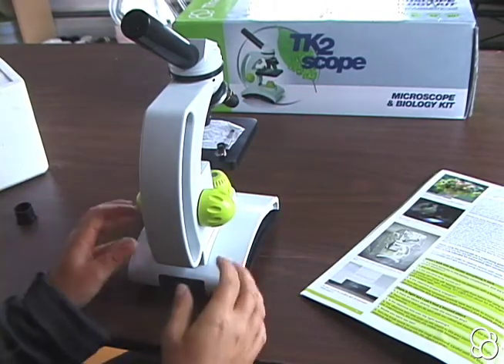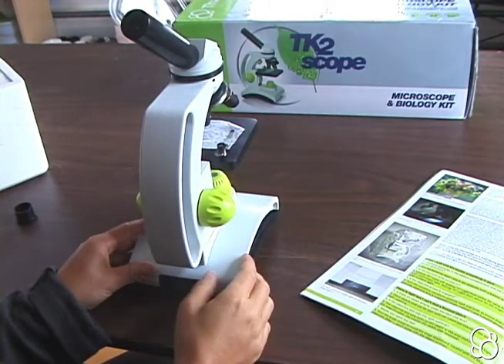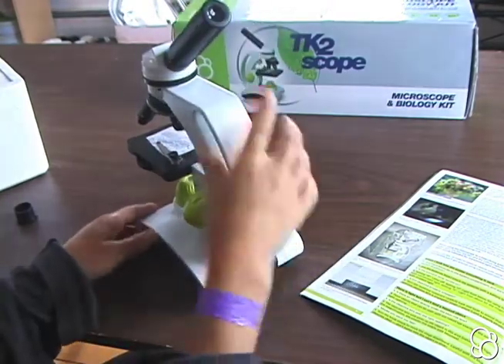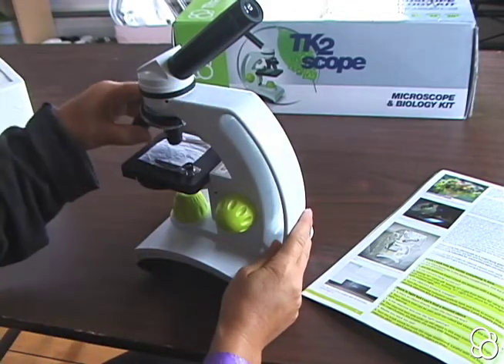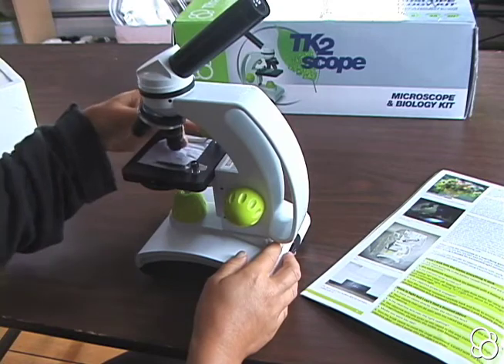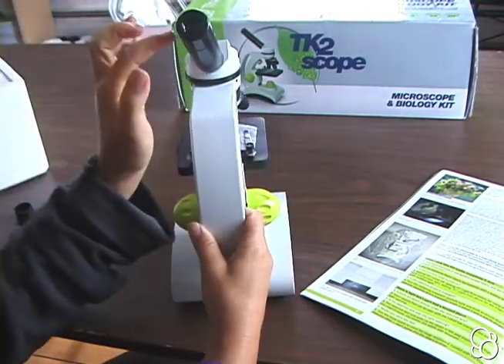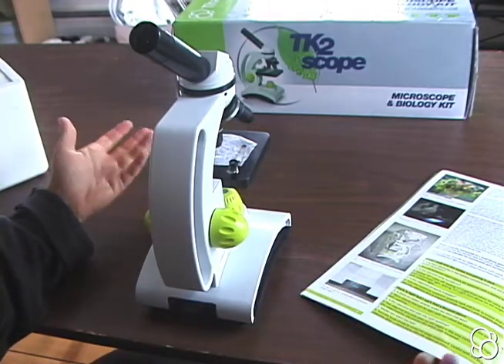If you want to know the magnification with which you're looking at something as a microscope, you multiply the number on the ocular lens — which is 10x magnification — by the number on the objective lens. These lenses down here are the objective lenses. So if I have it on the yellow one and the yellow one is 10, then 10 times 10 is 100, meaning what I'm looking at is magnified 100 times its actual size.